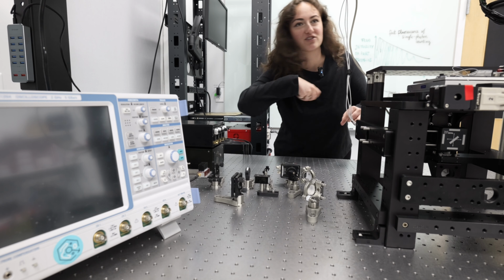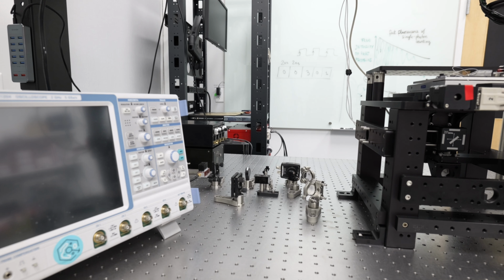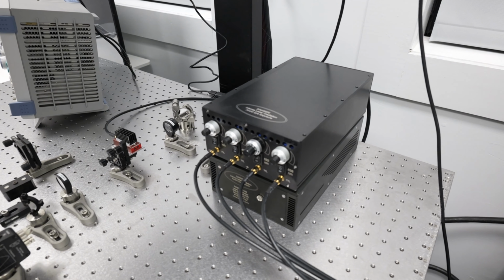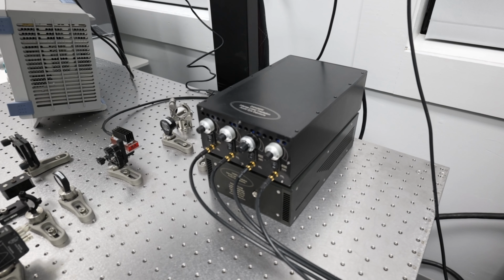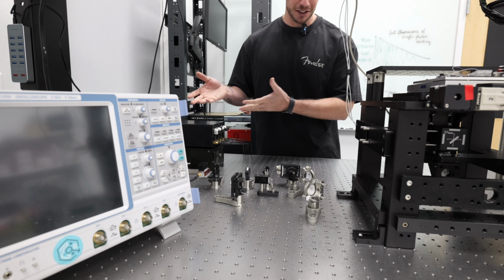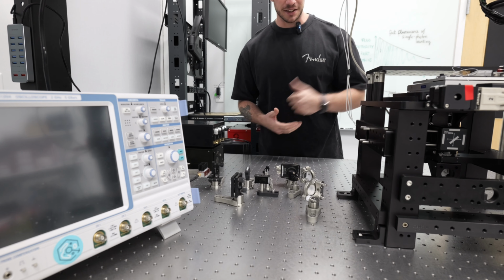This makes the lasers for the microscope. Yep, I'm confident about that one. Locking it in. This is a laser system with 4 different wavelengths that we can control via TTL. And yeah, so this provides the illumination that we need to investigate our samples.